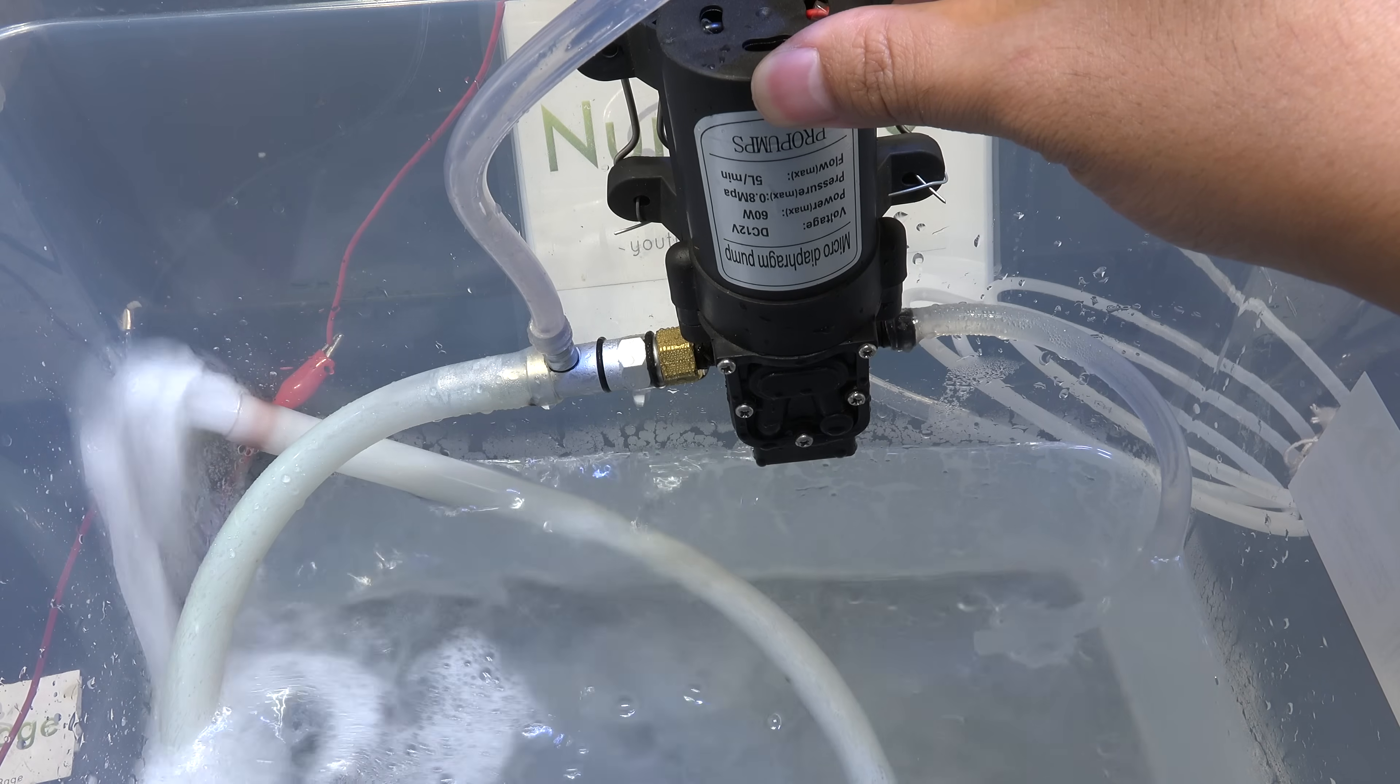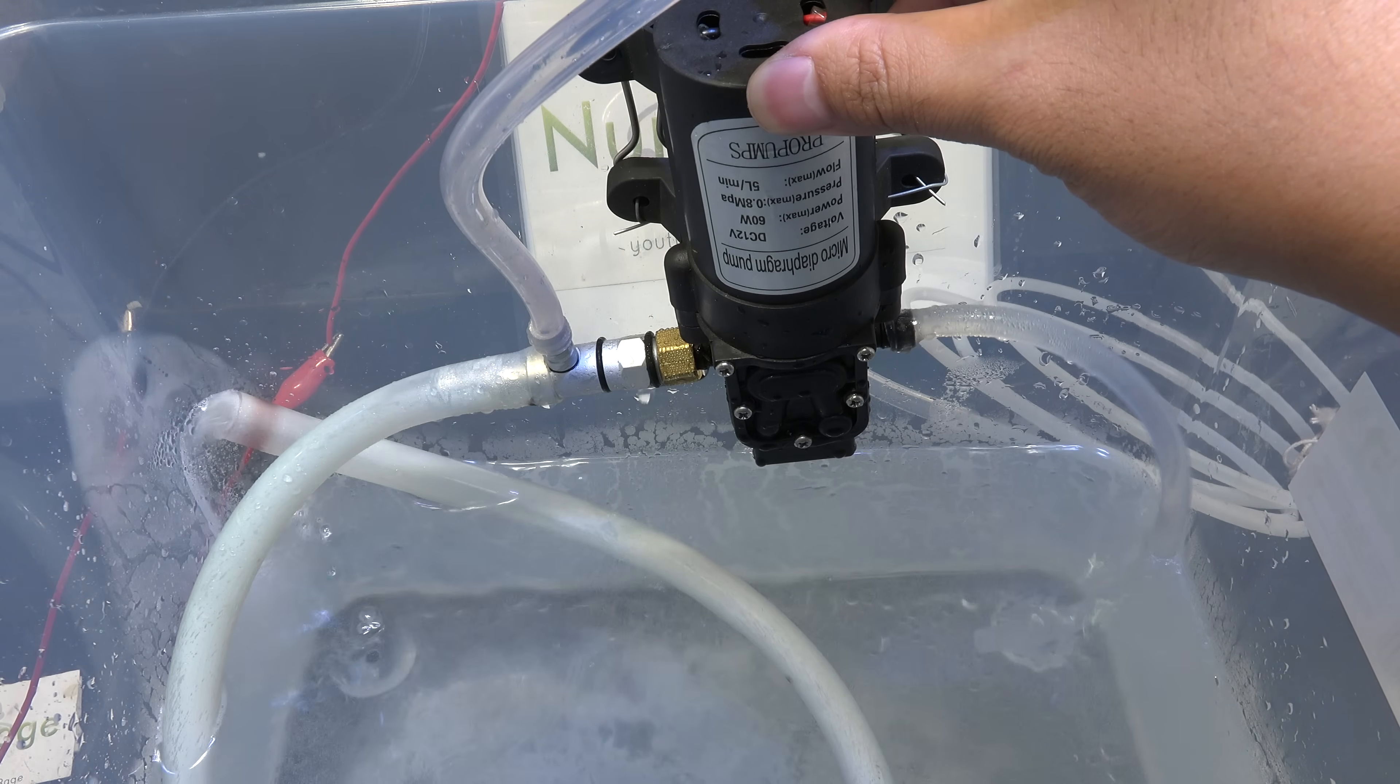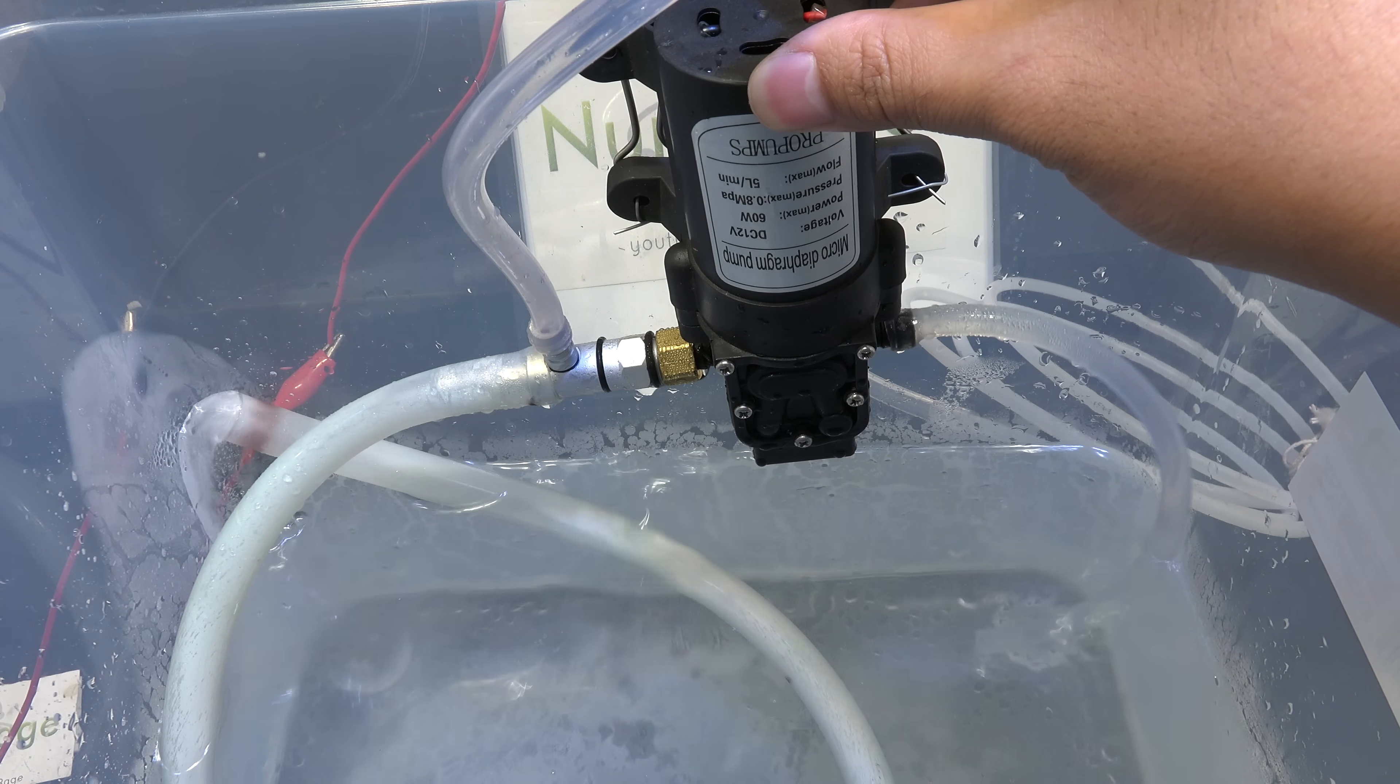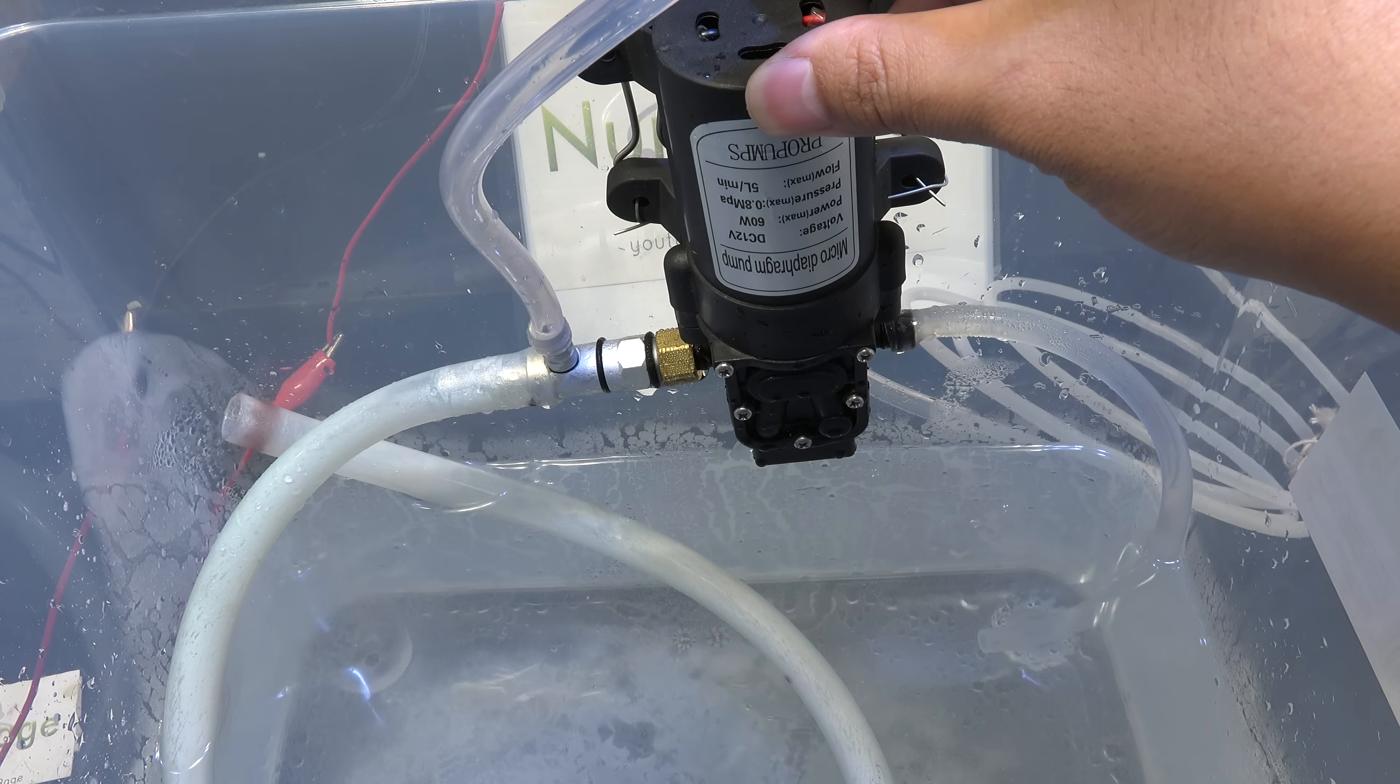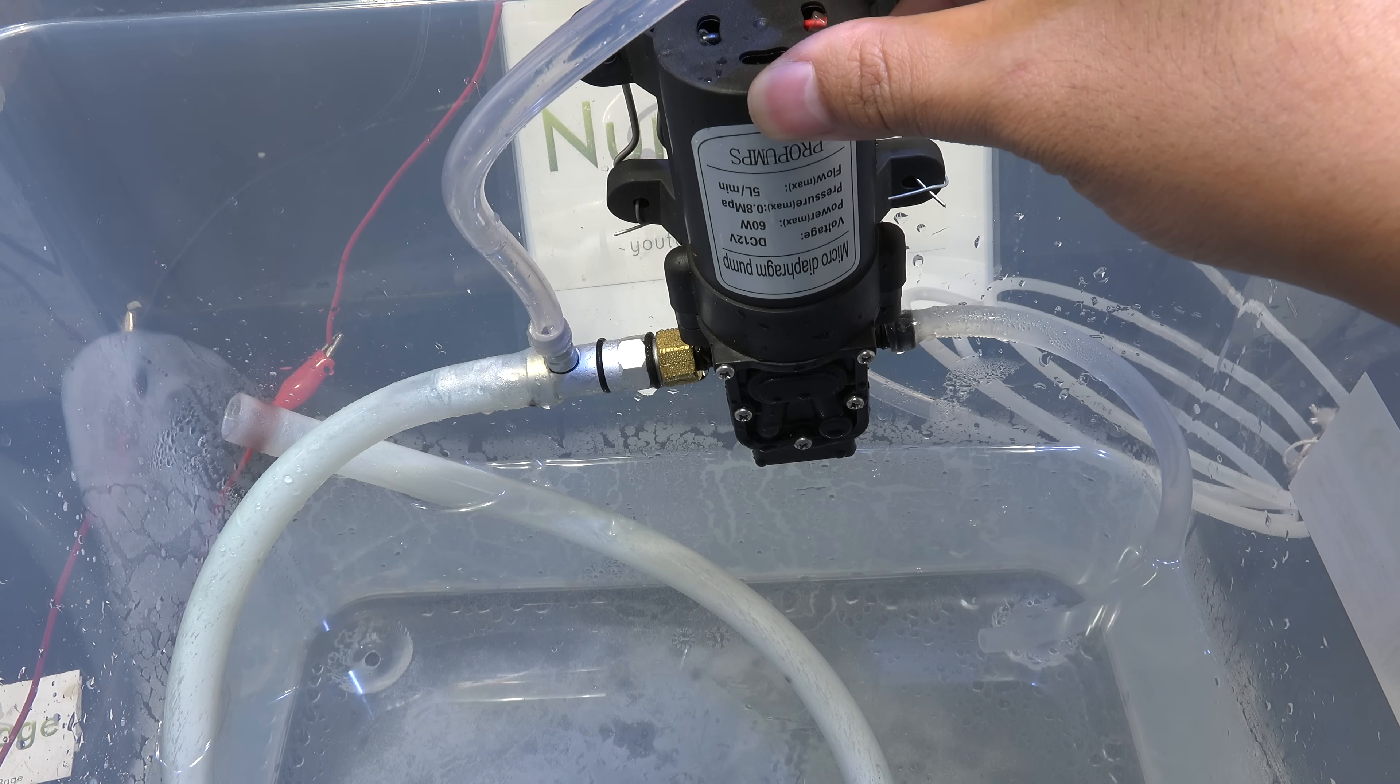But if you are working with toxic gases or solvents, I still recommend placing this vacuum pump system outside or in a fume hood and leading the tube to where you need your vacuum. The solvents can still evaporate off the reservoir and fill your lab. If the gases don't dissolve fast enough they'll also end up in your lab.